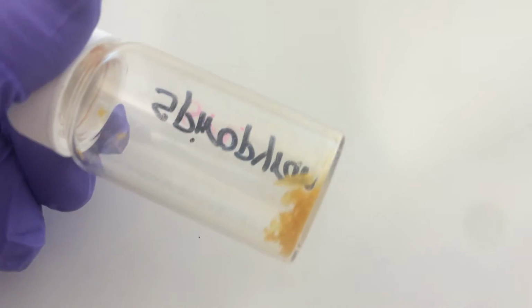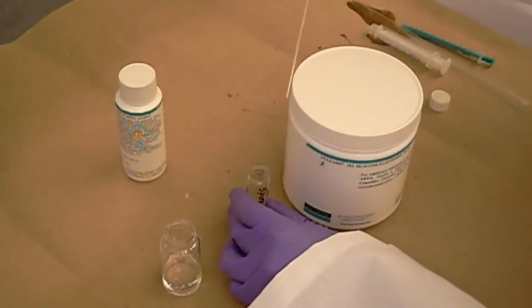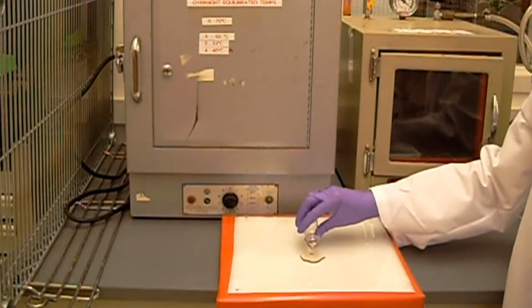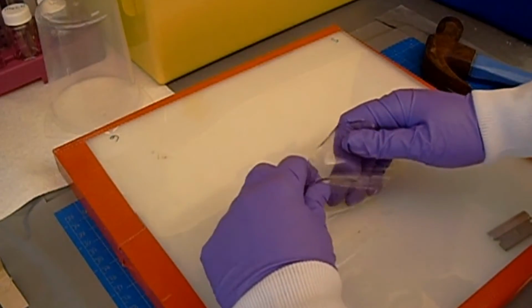After we synthesized the spiropyran, this is what it looks like. We incorporated this molecule into PDMS films using the Sylgard 184 silicone elastomer kit. This mixture is left to dry in the oven until all of the solvent has been evaporated and we're left with this nice, smooth film.